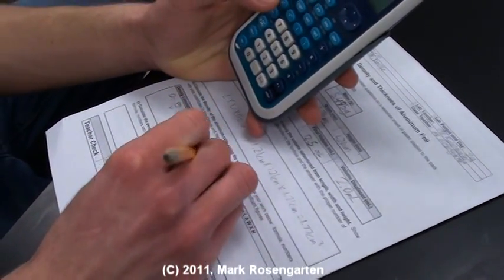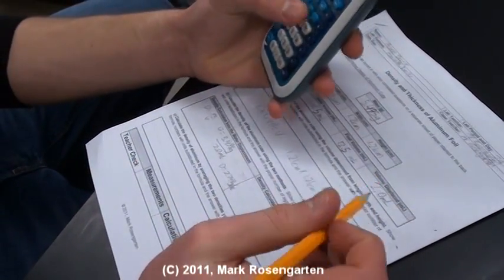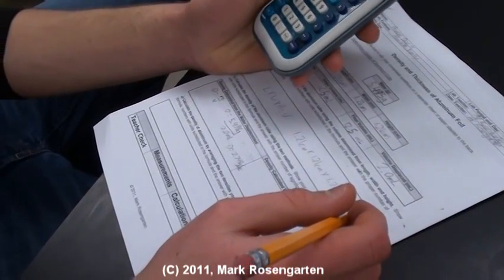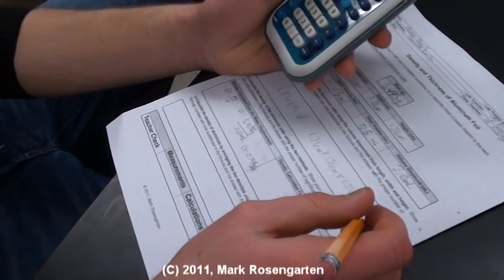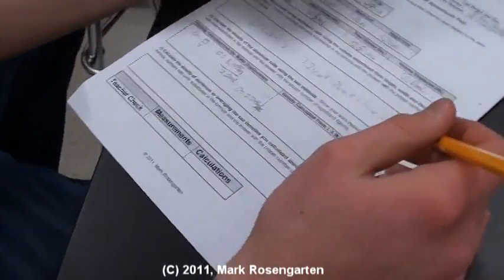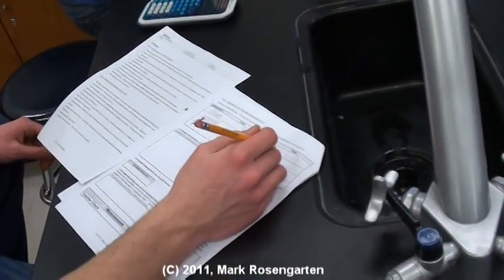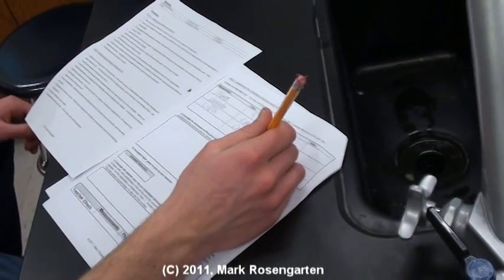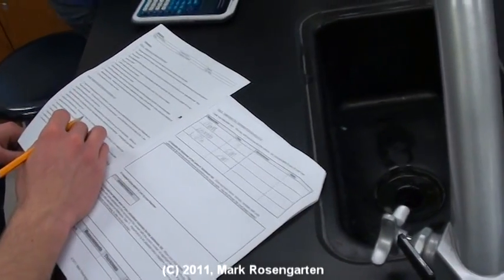First, calculate the volume by length, width, and height, and then calculate the density using the same mass for both, but using the volume from water displacement for one calculation and the volume from length, width, and height for the other calculation. Then average the two densities together and place it in the bottom, then call your teacher over. Now that you know the density of aluminum, figure out what you need to calculate the thickness of the aluminum foil, and go ahead and determine it.